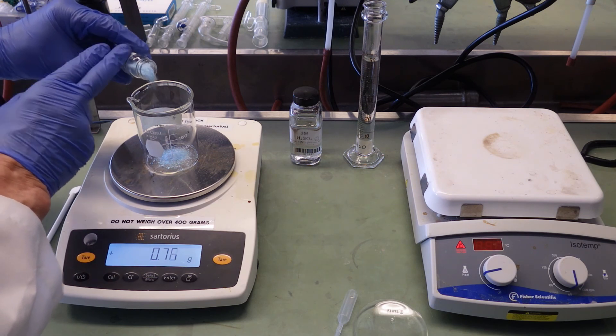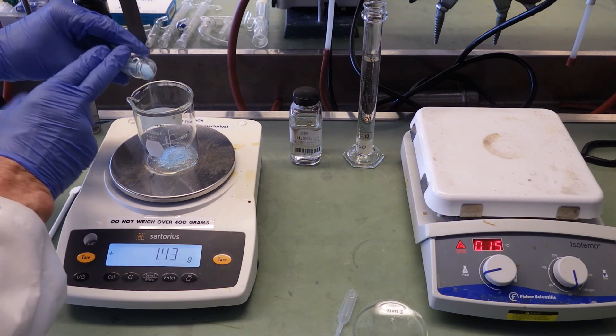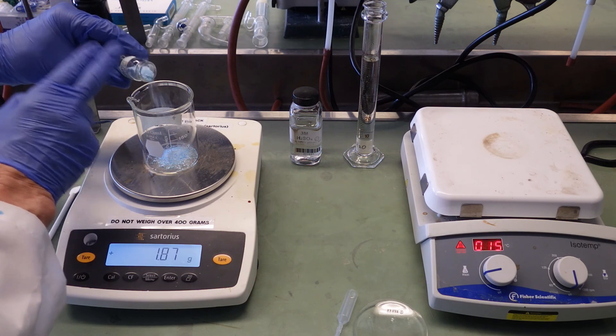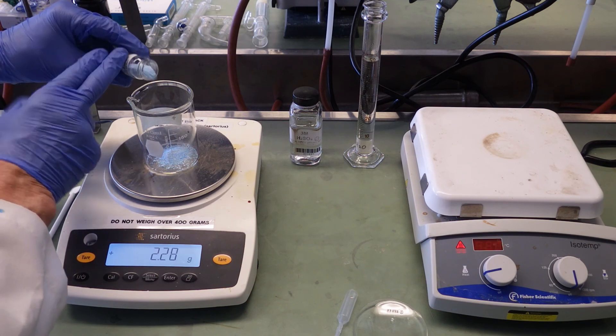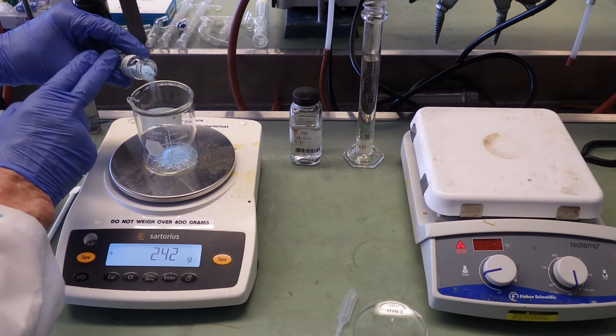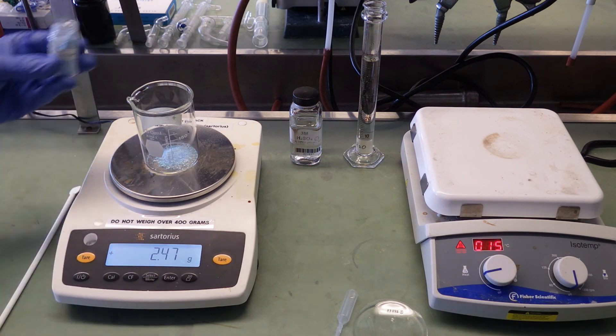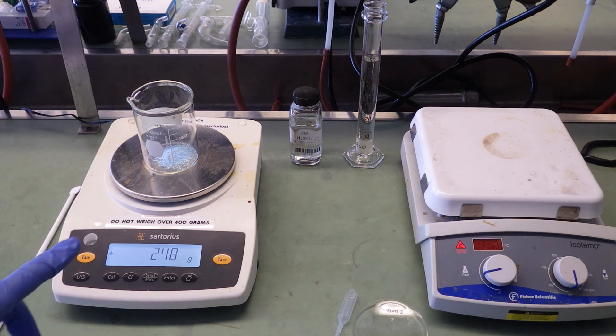You want to record the mass of CSP salicylic acid mixture. 2.48 grams looks good.